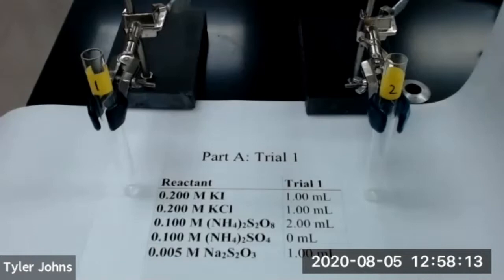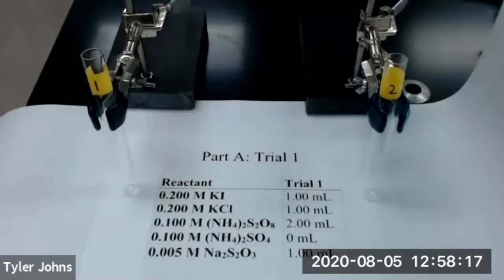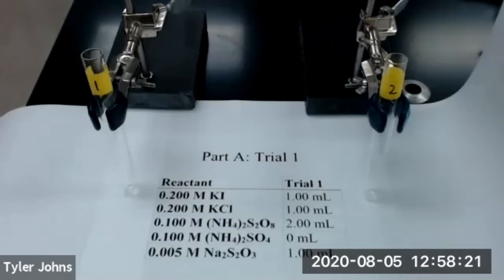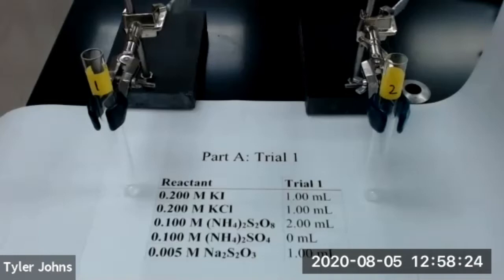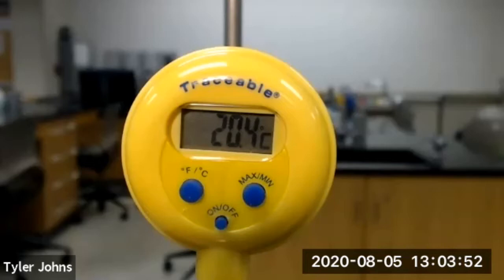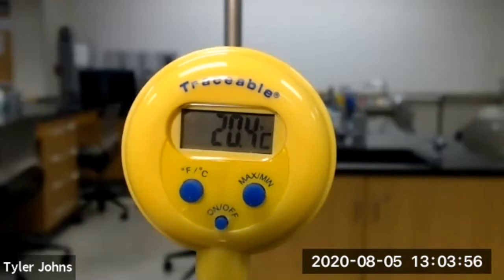In part A of this experiment, we're going to determine the rate law of our reaction. In order to do that, we will need to change the initial concentrations of iodide and persulfate ion in three different trials. We first need to record the temperature of our solutions at room temperature. Our solutions at room temperature are 20.4 degrees Celsius.